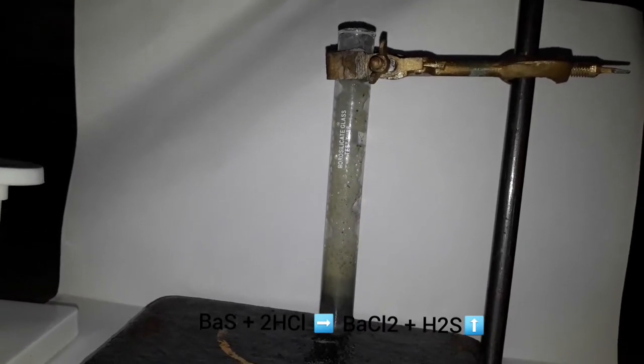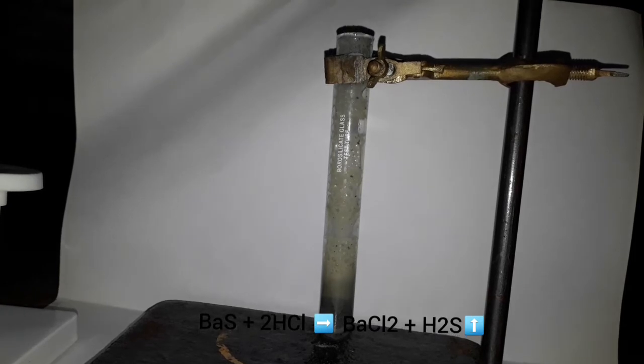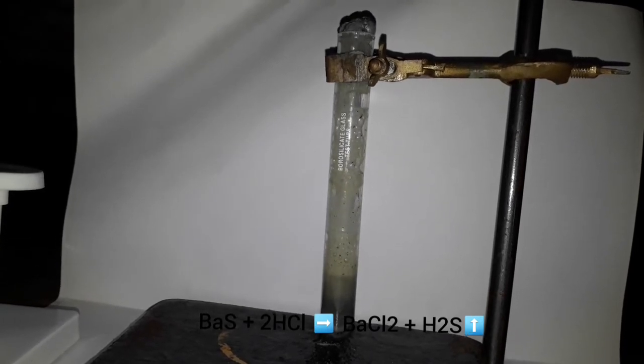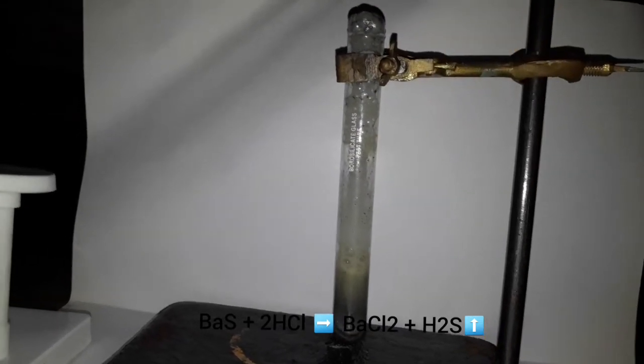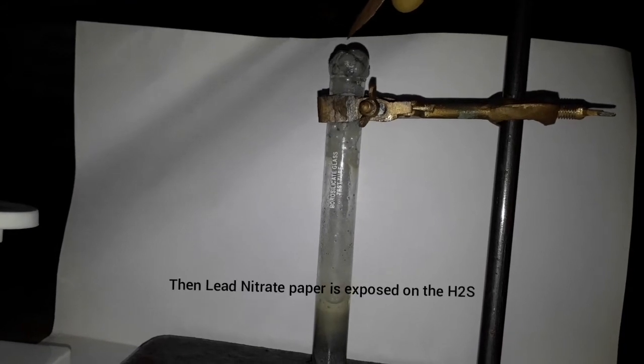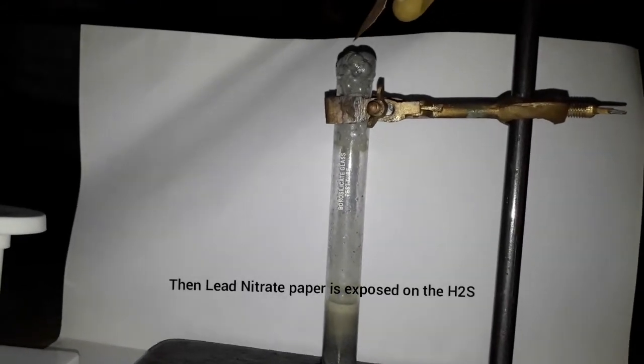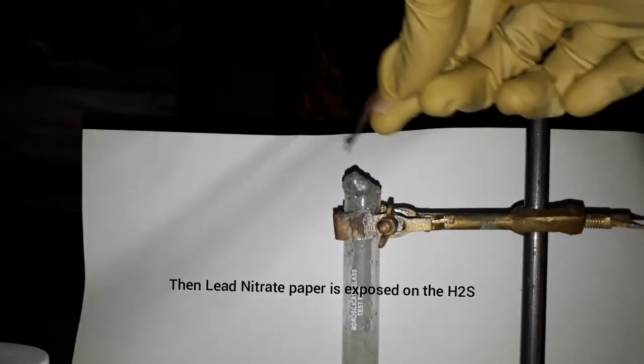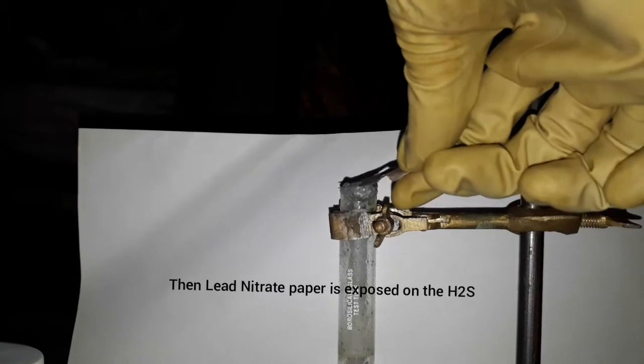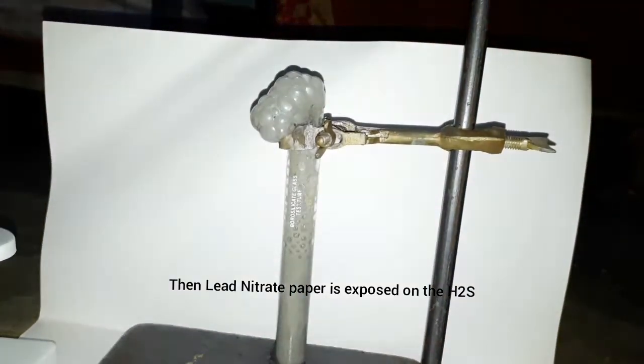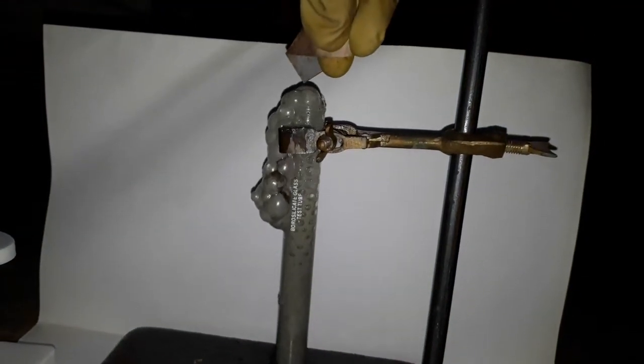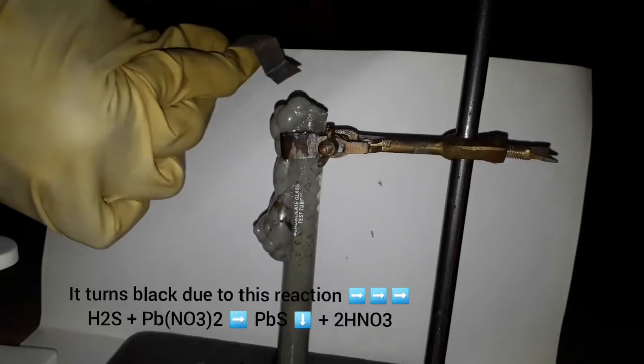Very irritating smell. Now I have lead nitrate Pb(NO3)2 paper. When exposed to the gas—oh it splashed—this turned the paper black, as you can see.